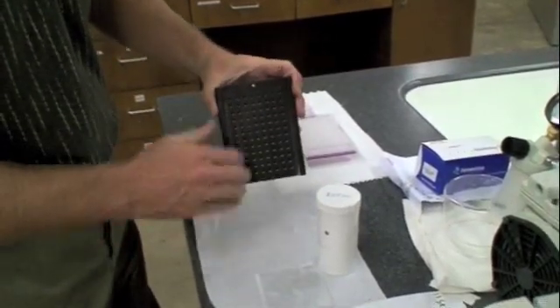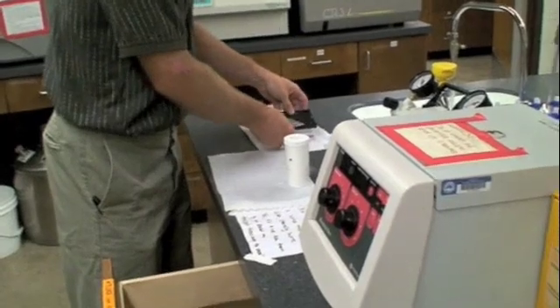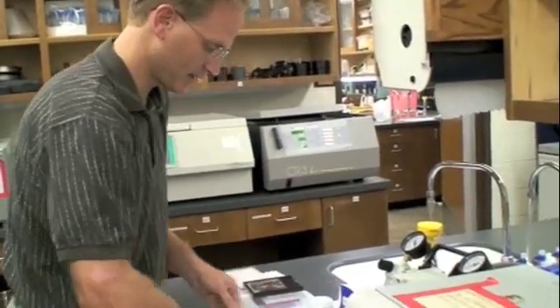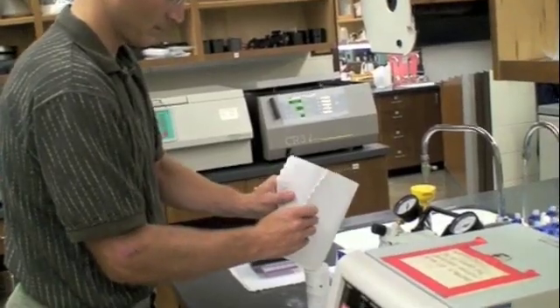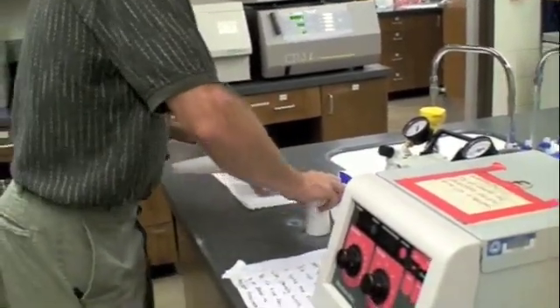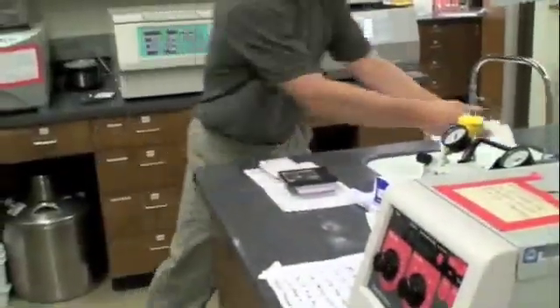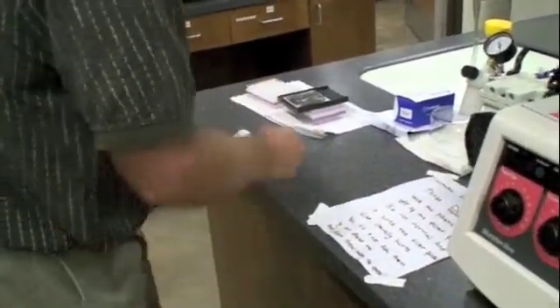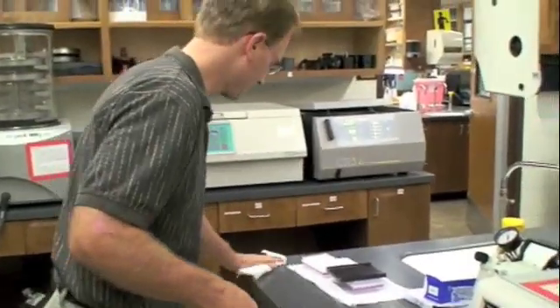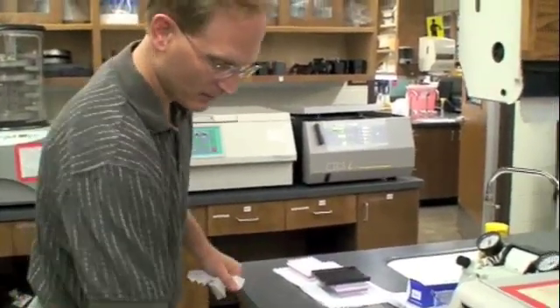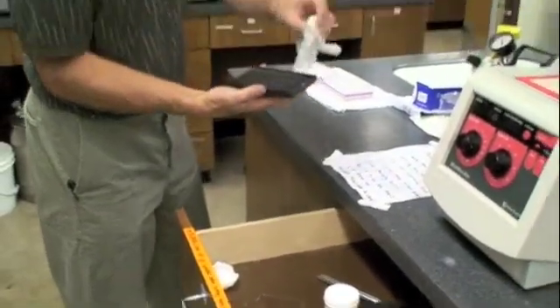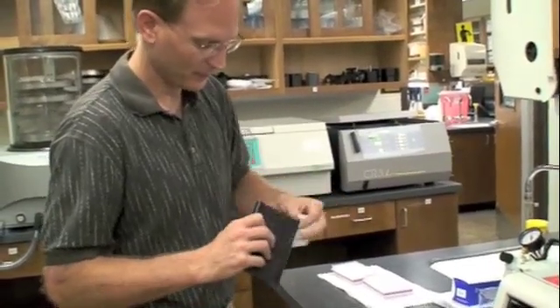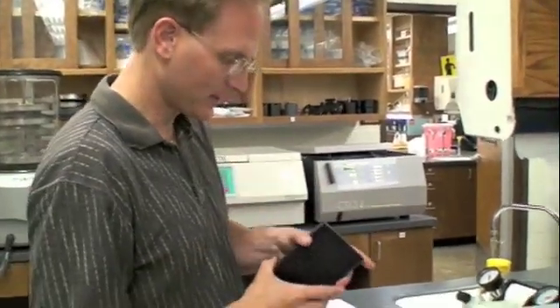Now you need to wipe this off when you're done using it. It should be cleaned off before they go into the drawer. I'm simply going to get what Sephadex I can still on this towel and pour it in there. Getting a little bit of distilled water and just wiping up all this excess Sephadex because it does make a mess and get everywhere. I'm just wiping that Sephadex off so it's just not filling the drawer full of material. Some of these have Sephadex in it. We're going to have to clean them out later.